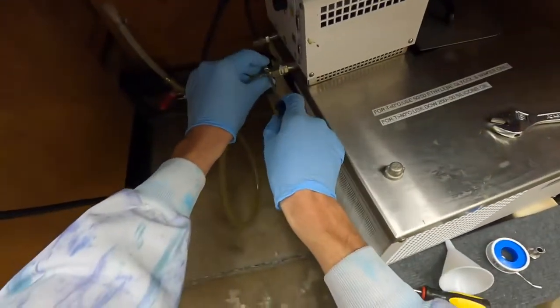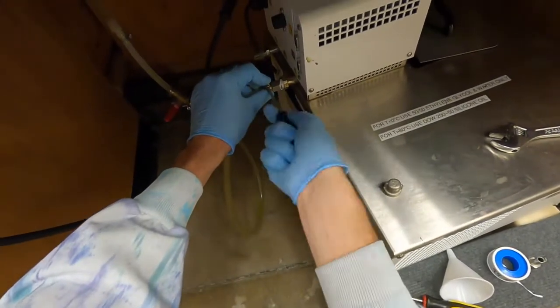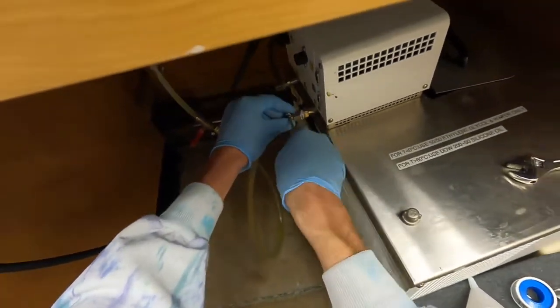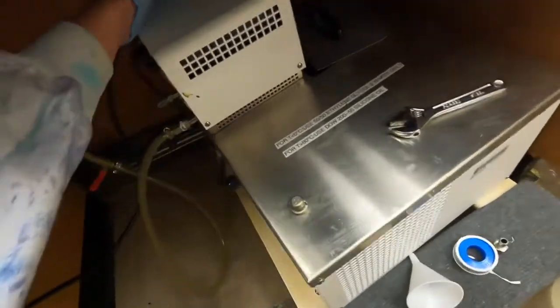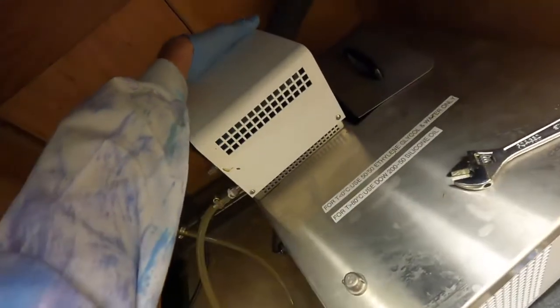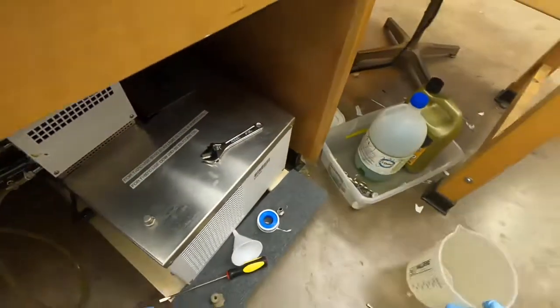We'll just go over these last clamps, make sure these are tight. And then to turn it on, there's a switch on the back up here, just a normal flip switch.